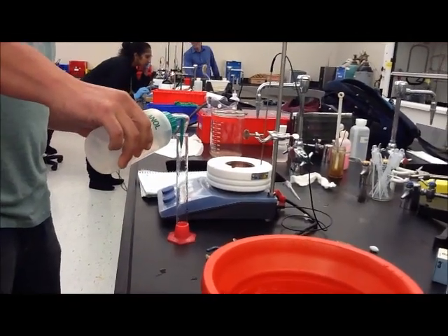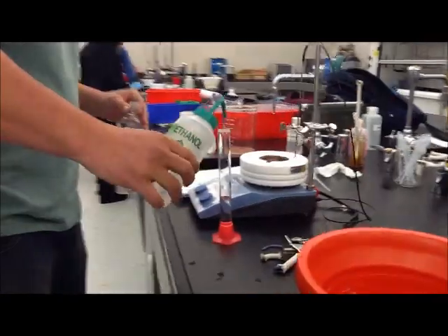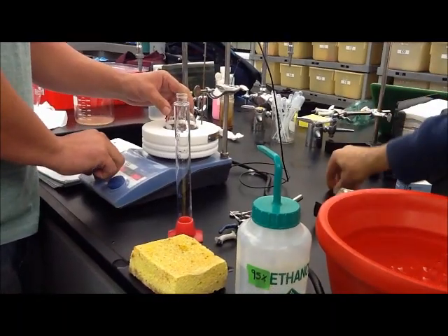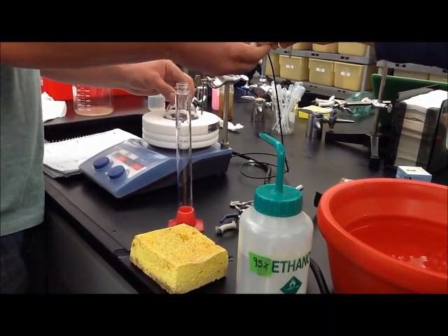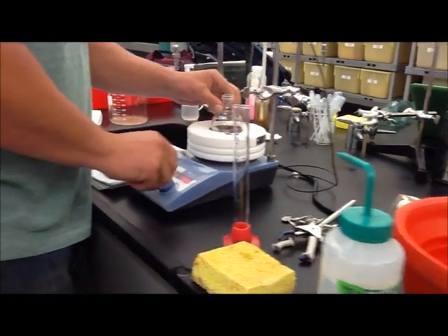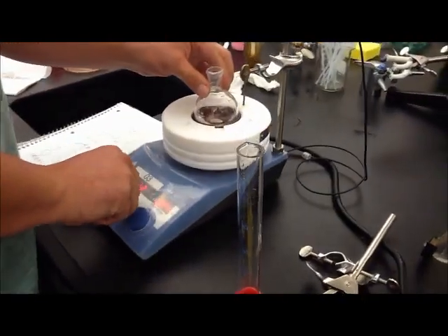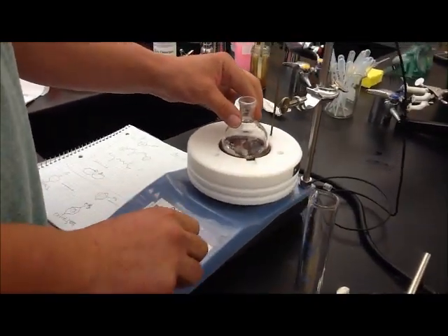Throw this in and stir it. What should we heat it to? Put it at 100 or 150 to get it going. What if it blows up? It would probably be more than 30.